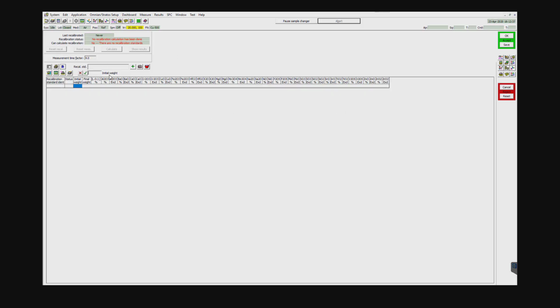Here we're going to start with a measurement factor, time factor. This is the application measurement time multiplied by whatever factor you specify here. This is going to improve the counting statistics, which will improve the precision of the measurement. Generally it's default to 2, but we recommend going to 4 since increasing by a factor of 4 will decrease the counting statistical error by half.